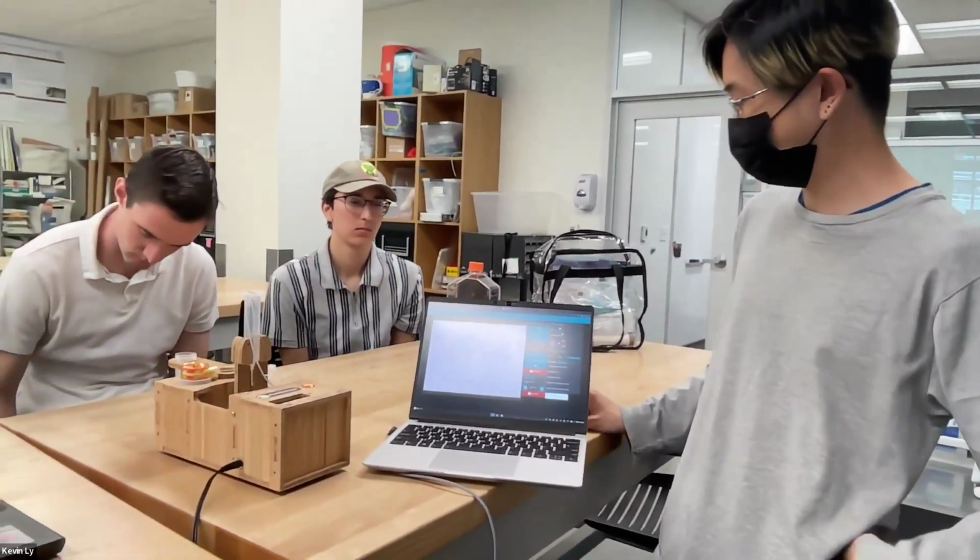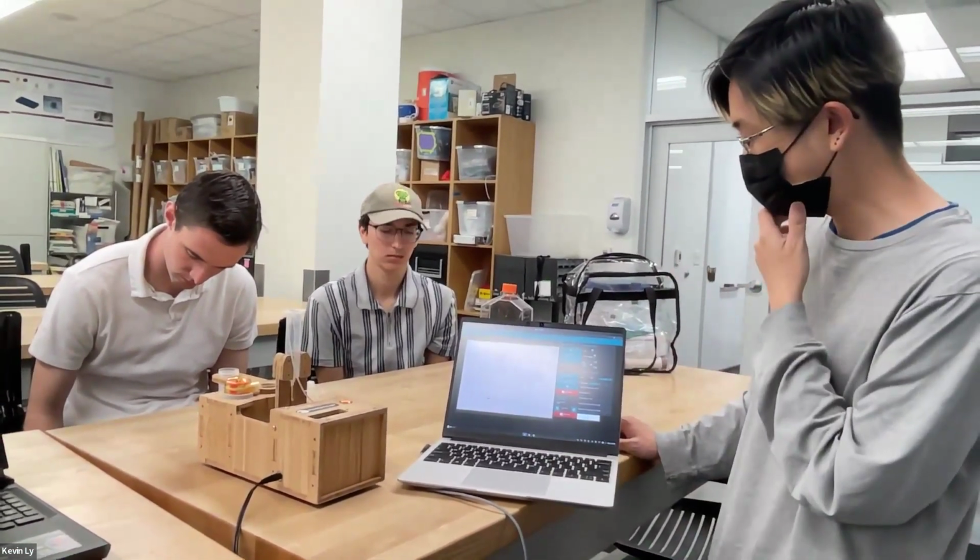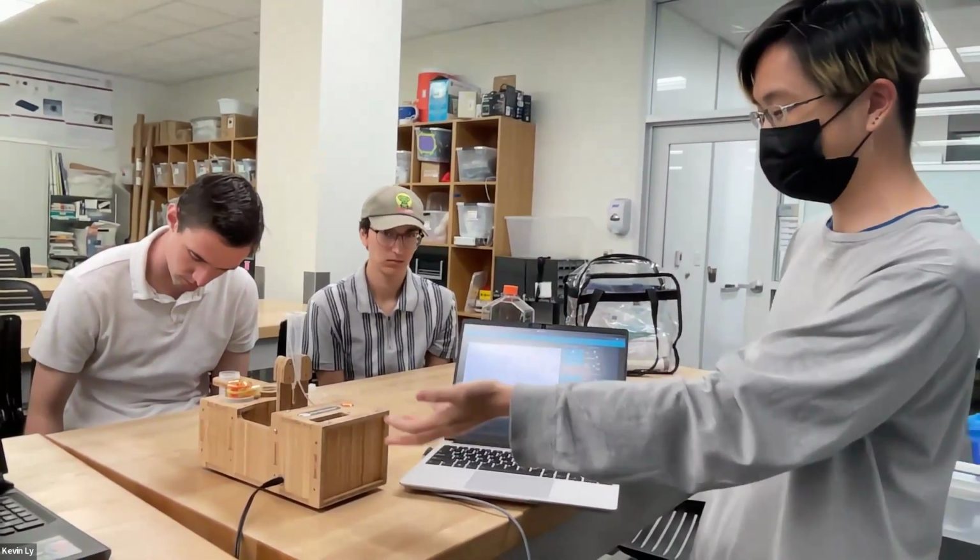It's something where you just need to collect enough raw images that you have enough objects and good statistics on things that are in focus. I think the company that makes these microscopes is now working on providing different combinations of lenses that can work better with thicker capillaries, if you want to image larger objects like copepods.